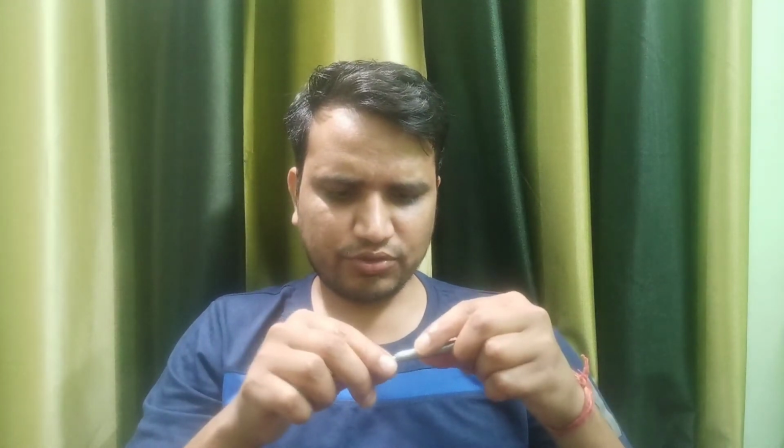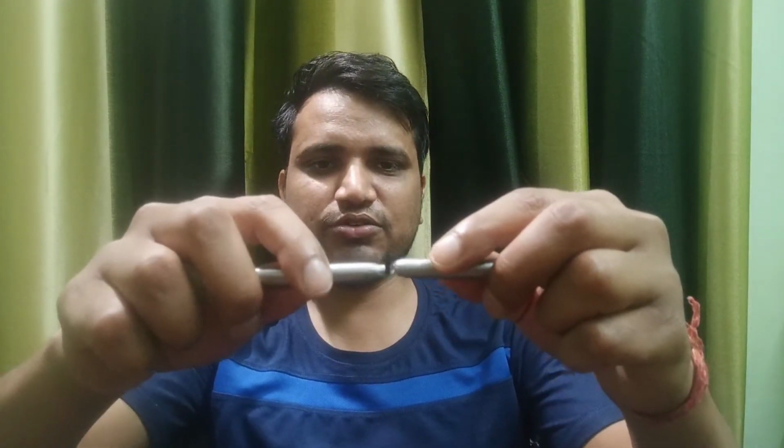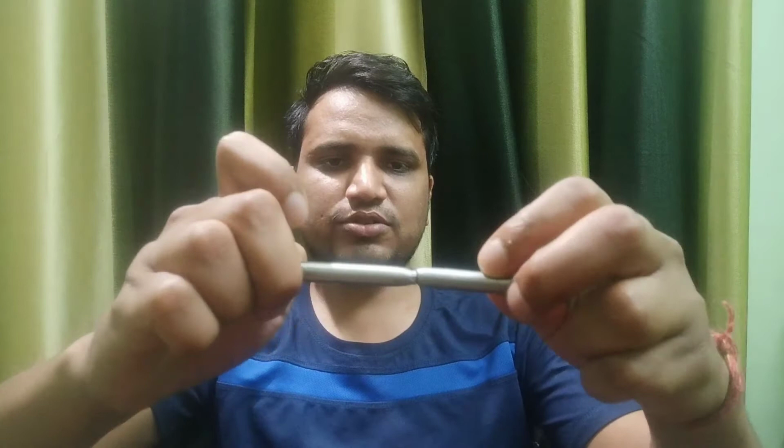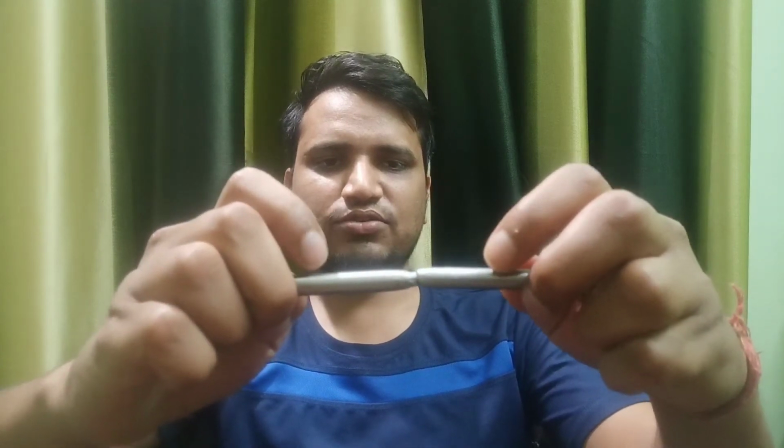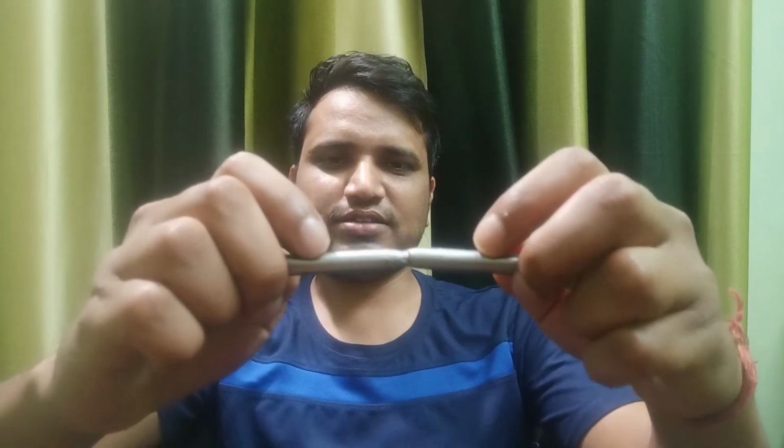We just join it together properly after the fracture. I think some more part has been chipped off because this sample is very old, so that's why it is not fitting over here. Now suppose you have done this, then you again measure the length, and that is the final gauge length, and you can calculate the ductility, the percentage elongation, the percentage strain, or the strain value.